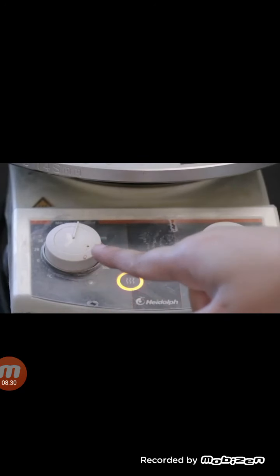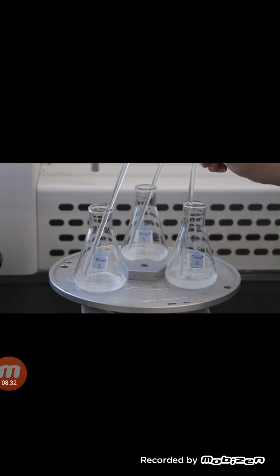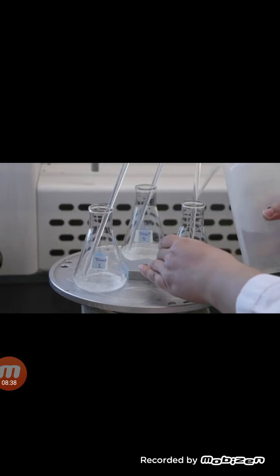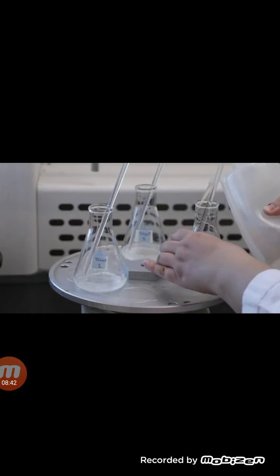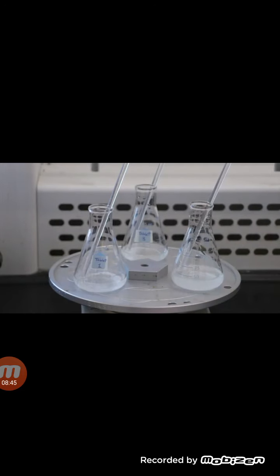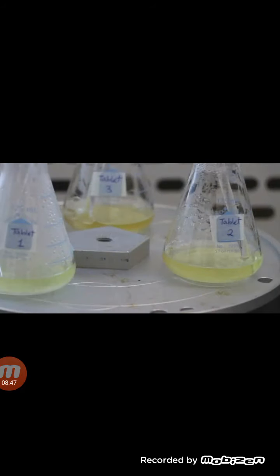Put them on the hot plate so they dissolve. Use the glass rod to gently crush any tablet bits that remain undissolved. If any solution gets on the sides of the flask, wash down the walls with a small amount of distilled water. This will help ensure that all the contents of the flask are quantitatively hydrolyzed. Once the solutions come to a boil, remove them from the hot plate and allow to cool to room temperature. Placing the flasks in beakers of tap water will help speed up the cooling process.